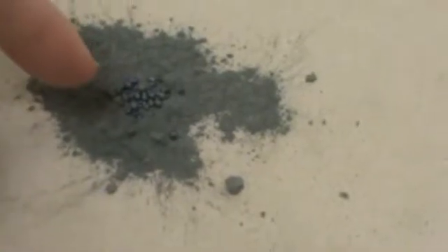What I'm going to do is mix the zinc dust with some of the iodine crystals. I want to take the metal and react it with the non-metal to form a salt. To get them to react, I'm going to add a little bit of water.